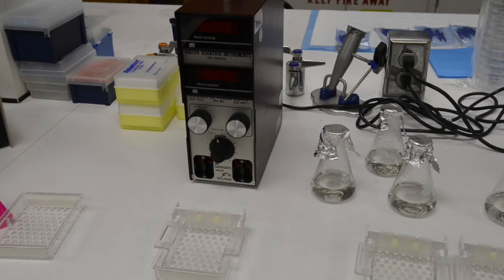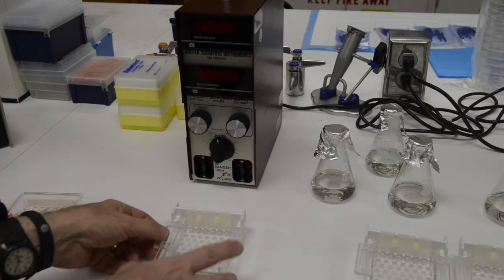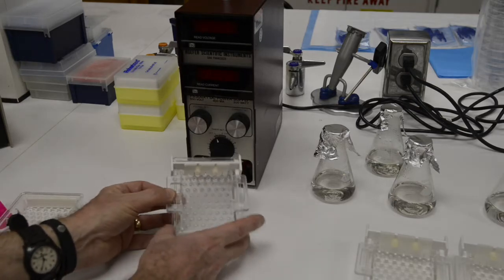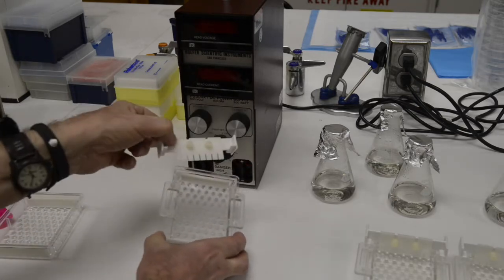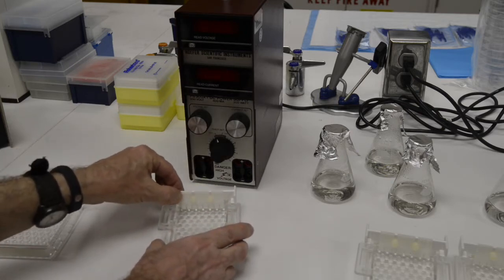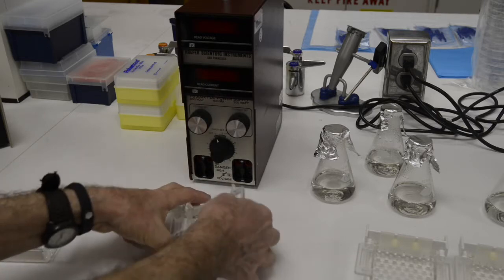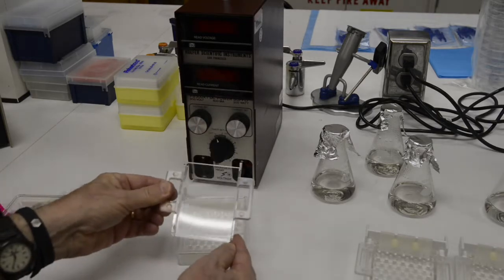This video reviews the process of using gel electrophoresis to separate or really to identify the success of the PCR that you should have already conducted on the picked colonies from the microbiome cultures.